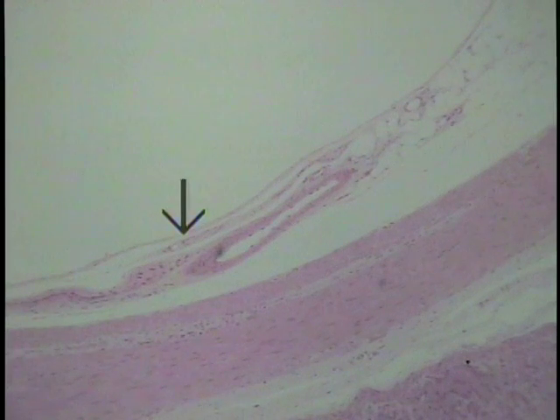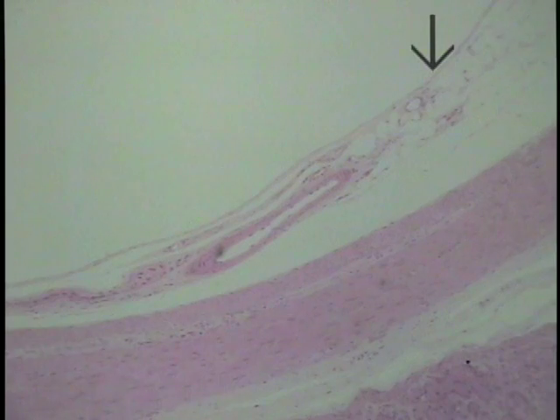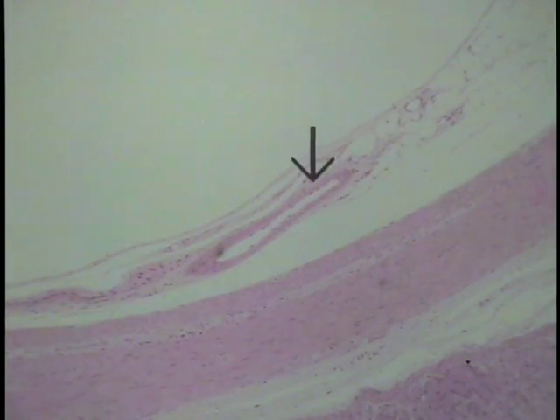It is this surface at the tip of the pointer that is going to be lined by a mesothelium, a form of simple squamous epithelium. And if one looks in this particular field, there's a small artery present here. Even at this scanning power, one can make out little dense nuclei. This would be the endothelial lining, another form of simple squamous epithelium specific for the cardiovascular system at this particular location. Now let's look at these at increased magnification.